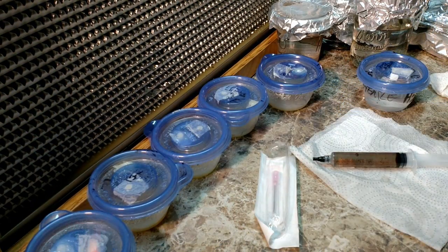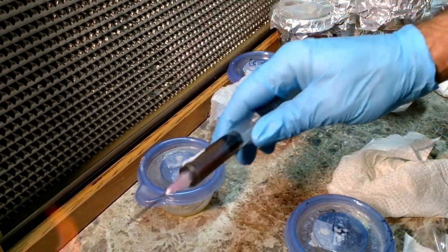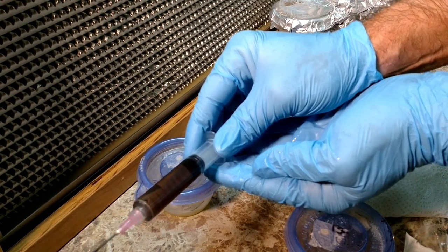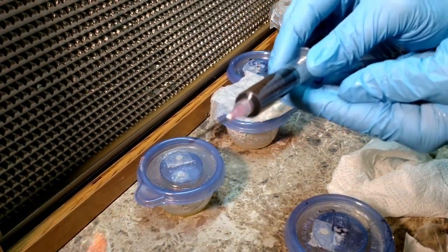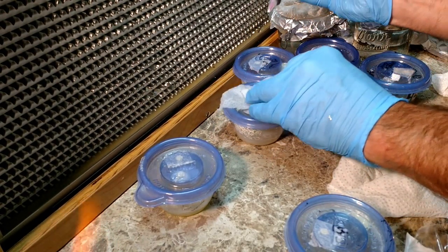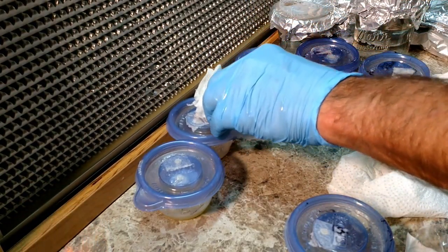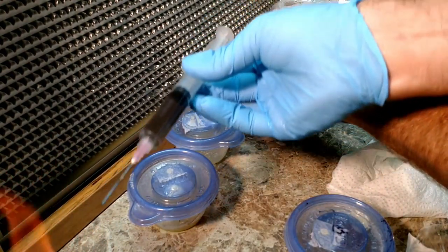There's also a needle there. Here's your basic step. Be careful with your hands — mine are covered in alcohol, so I'm not too close to the flame. It wouldn't be the end of the world if they caught on fire, it's just alcohol. So we're heating the flame, flaming that needle red hot, drop a couple drops, cool it off, right through the injection port, couple drops in. It's really hard to tell that you're putting anything in there — a couple of drops is nothing out of a couple of cc's, so that's another good reason to practice.